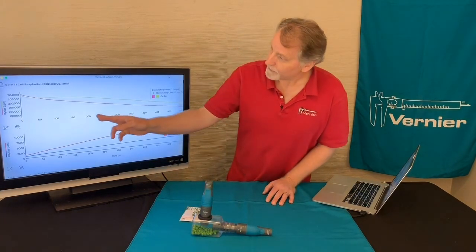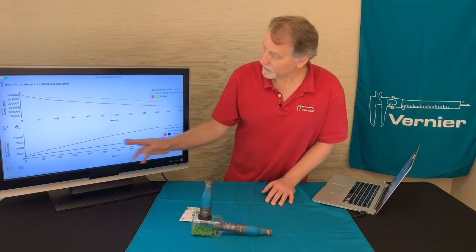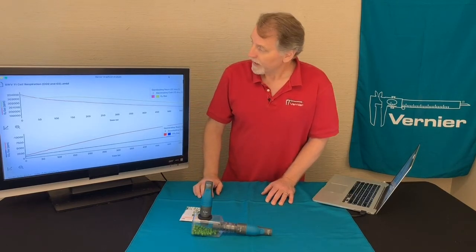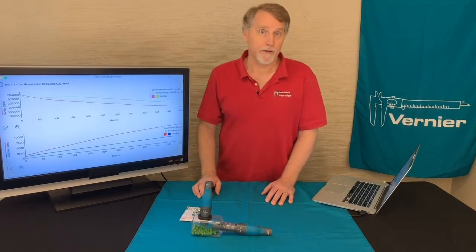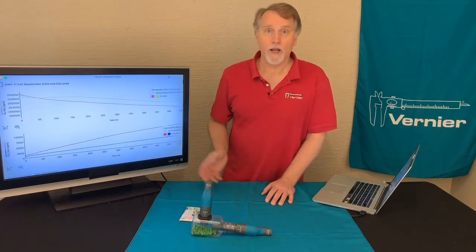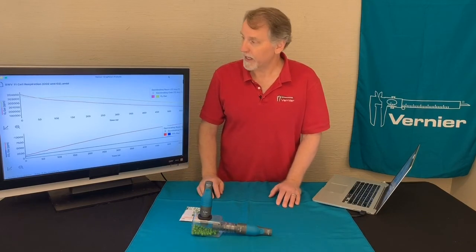The upper graph is the oxygen concentration in parts per million, and the lower graph is the CO2 concentration in parts per million. And right off, we notice something about them. We might notice that the slopes are different. So maybe one's going down, one's going up. Why is that? And so that's one of the things the lab wants you to investigate.